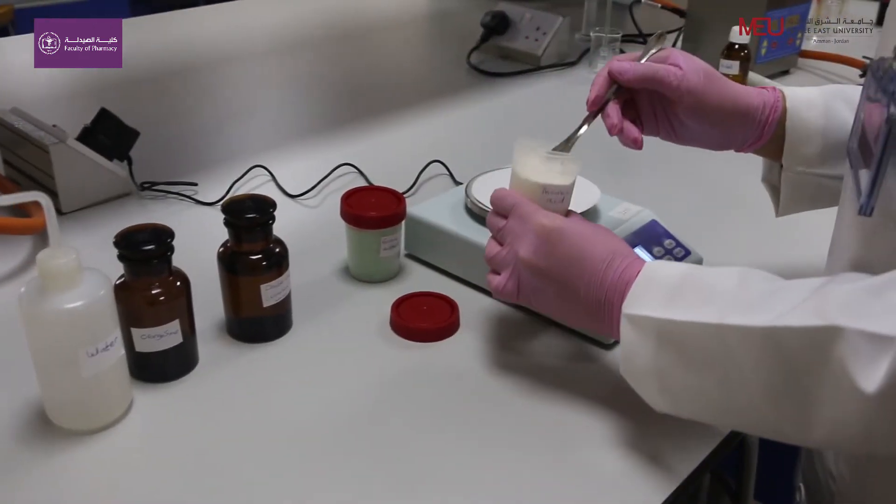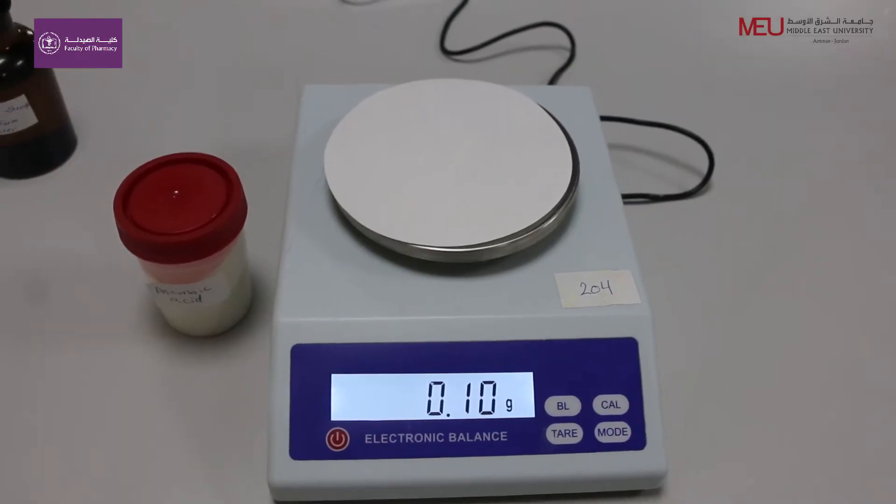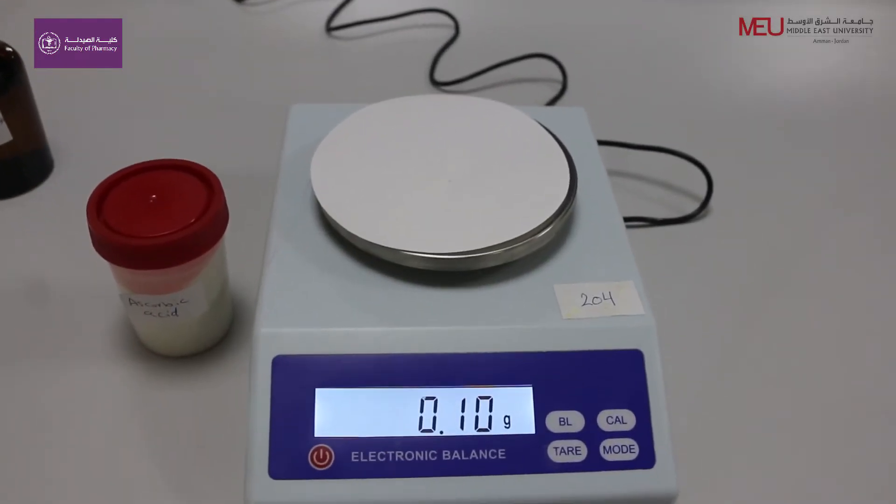Weigh 0.1 g of ascorbic acid. Ascorbic acid is used as an antioxidant.